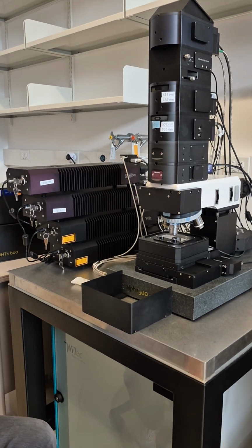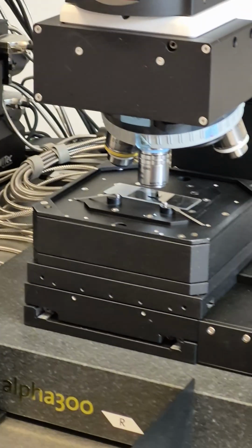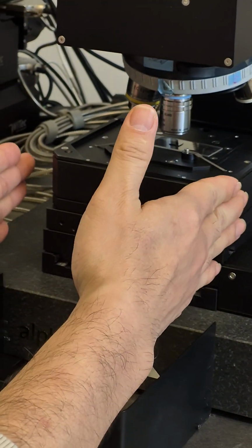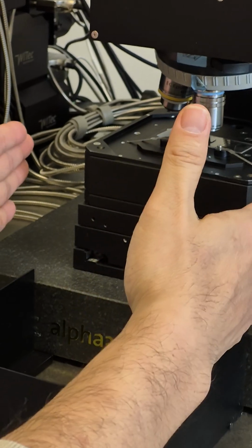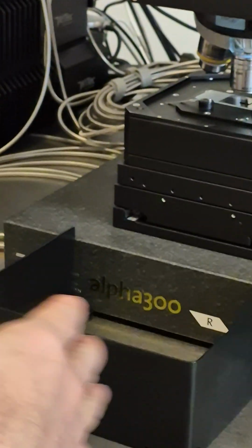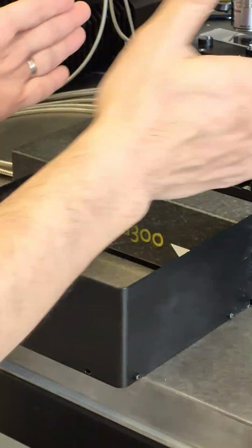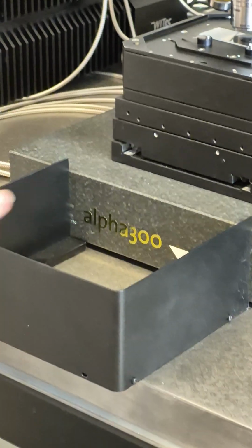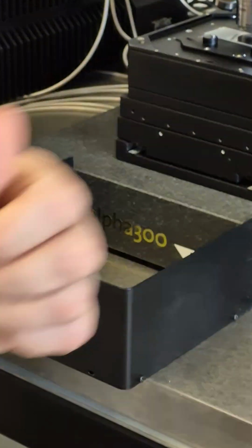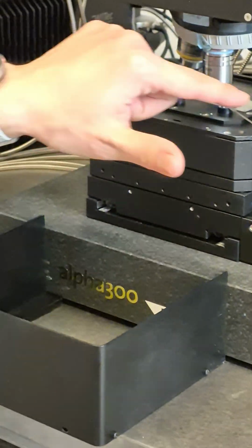And the position of the hole is the center of the stage, so you can easily locate your sample to the center, right? And these two springs, most of the time we don't use them, because the stage itself only does X and Y moves. It never tilts, never rotates, never goes up, never goes down. So you don't worry about your sample sliding off. Also the move is very slow, so the moment of inertia won't make it slide off. So most of the time we don't use these springs.